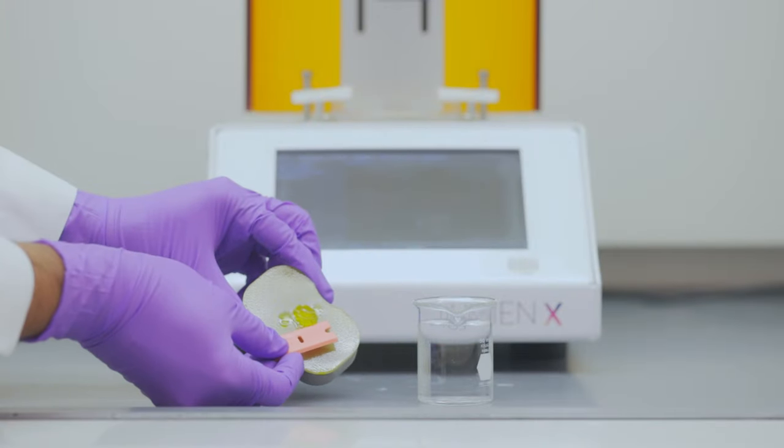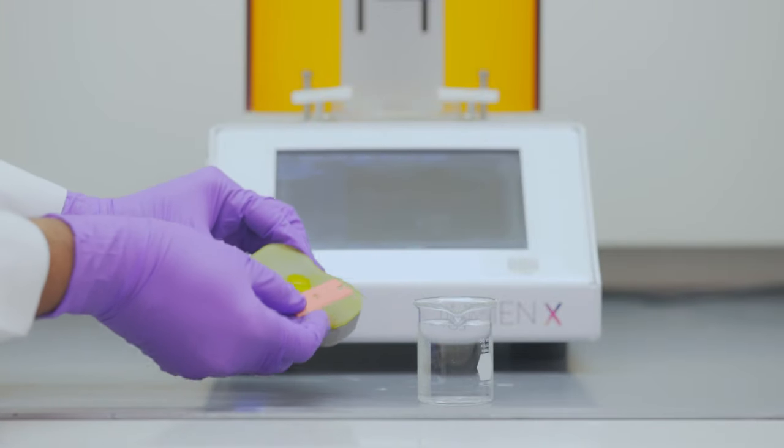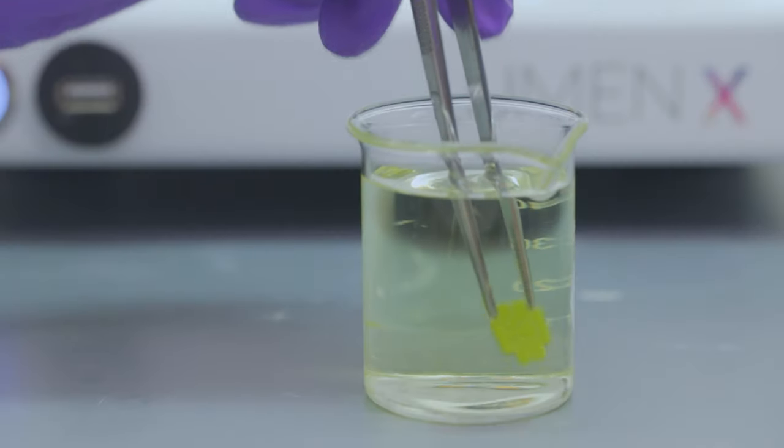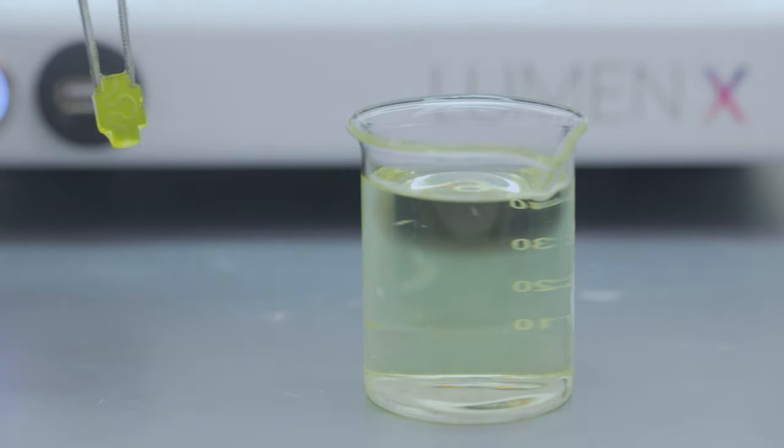Using a plastic razor, remove the printed object. We can remove the uncured photo ink using DI water. And here we have a washed and clean printed object.